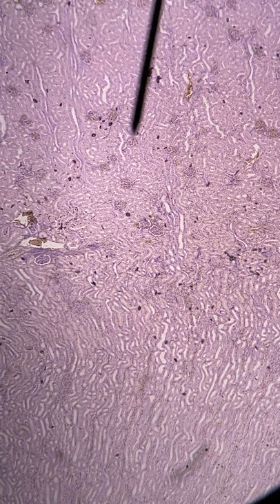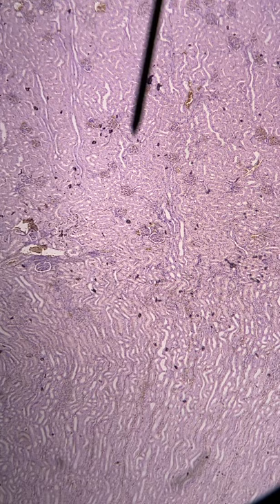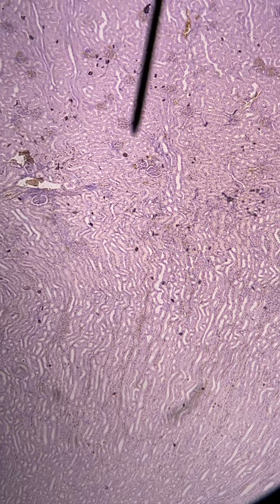And all these little squiggly lines in here are all those proximal convoluted tubules and distal convoluted tubules. You don't have to be able to tell them apart. But then suddenly you can see that all those corpuscles basically stop right there.